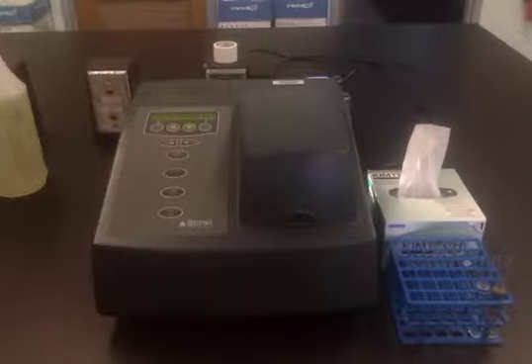Okay, the purpose of this video is to introduce the use of the GENESYS Spec20 as an analytical device for measuring the amount of light that is transmitted or absorbed by a particular sample.